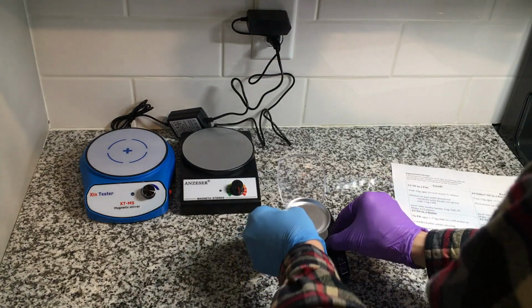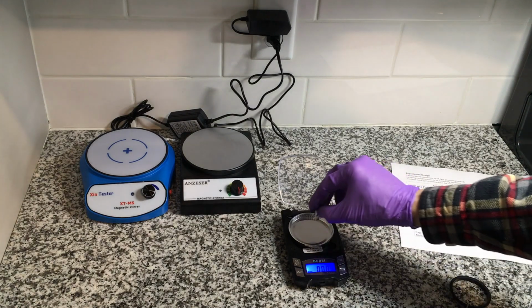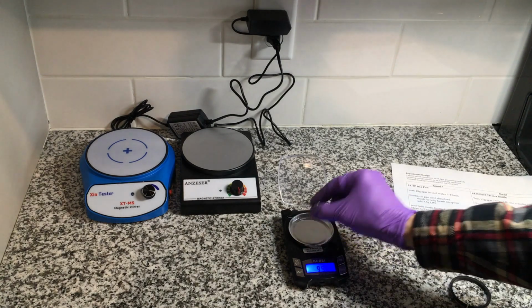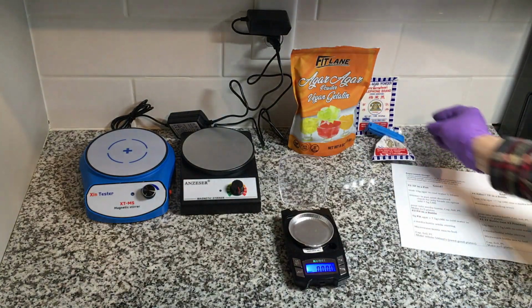My agar stopped growing anything for 2 months. It took me a couple of weeks to notice I even had a problem. A week to allow for initial growth, another to see if there really was a problem, waiting for growth, and a few more weeks to troubleshoot and try out the first change that I thought of, and that didn't work.